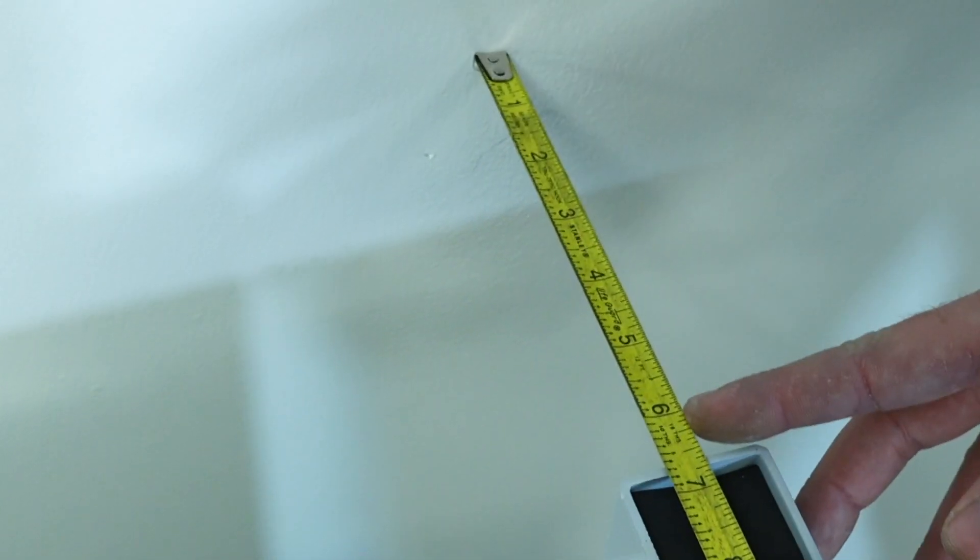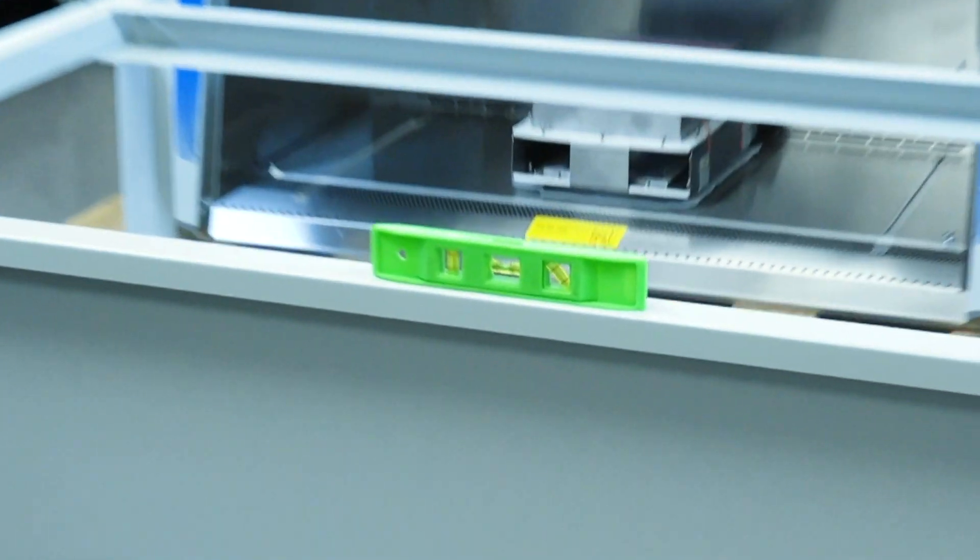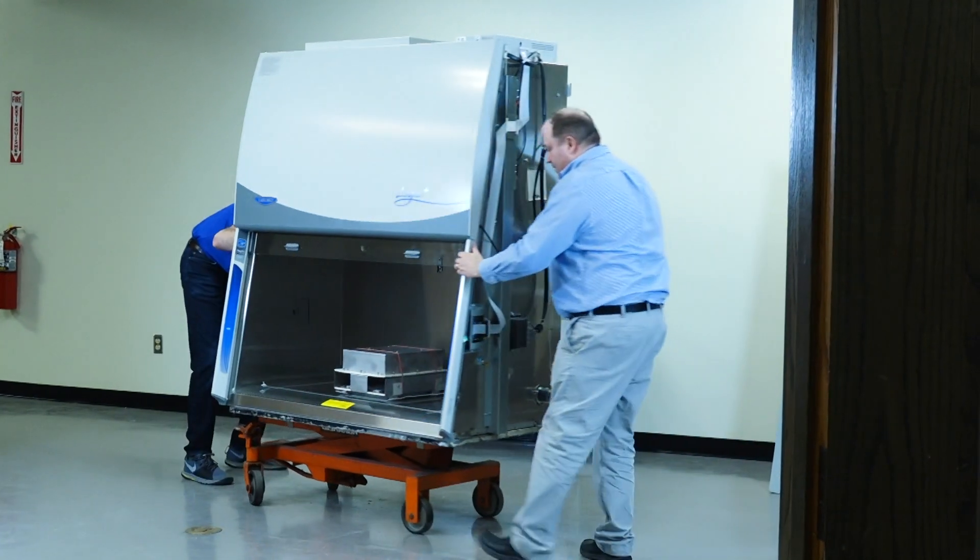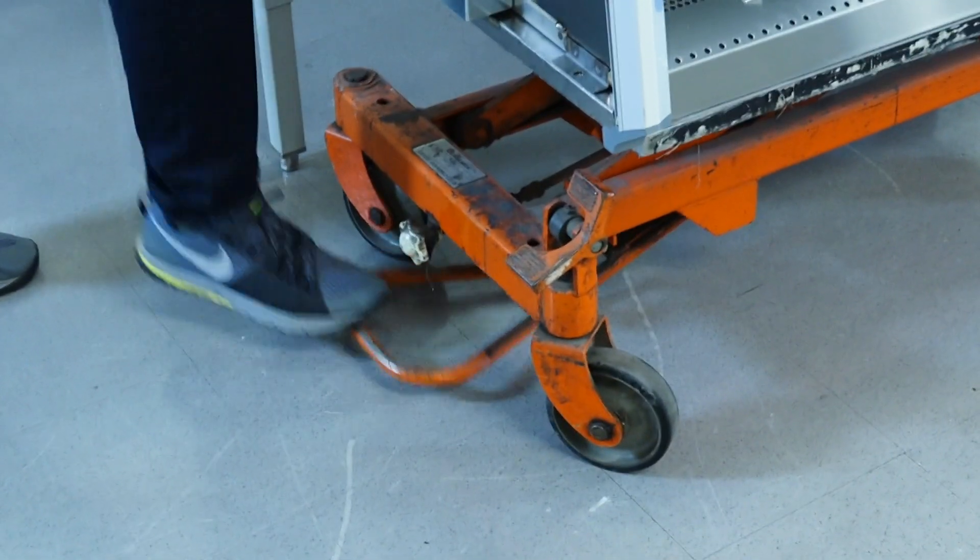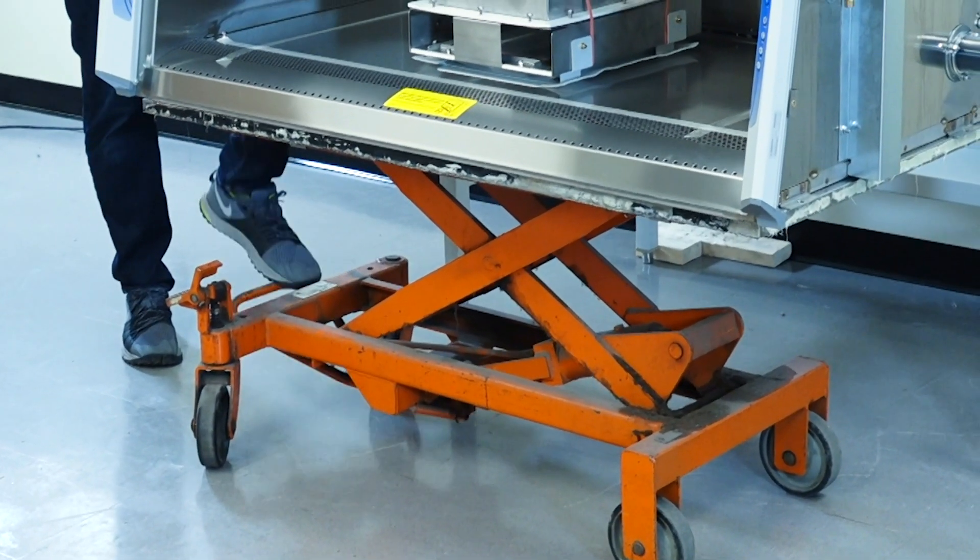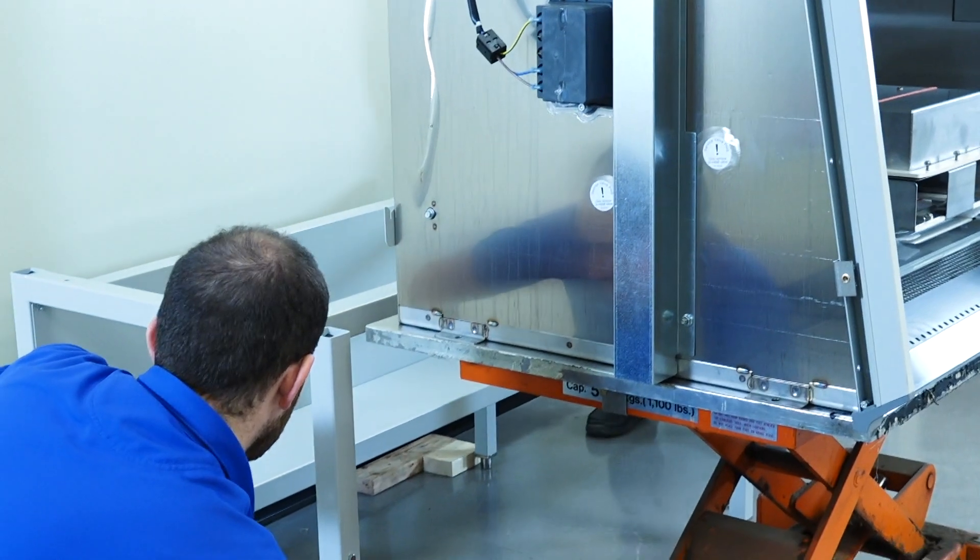Move the stand to your desired location and ensure that it's level. Now you're ready to lift the biosafety cabinet onto its base stand. The next step requires two or more people. Slide your Logic Plus onto a lift or hydraulic table and raise it to the height of the base stand.